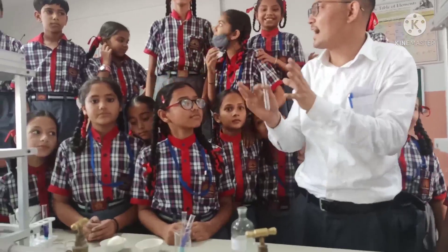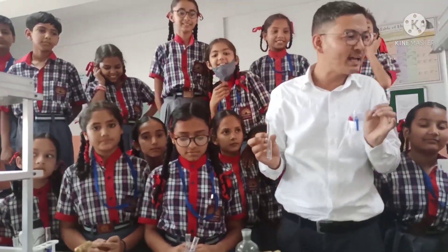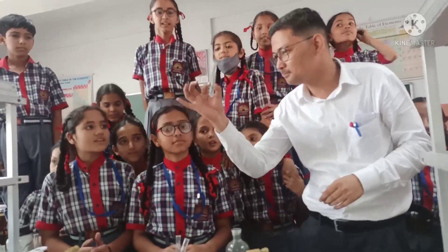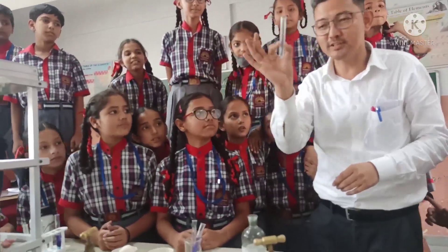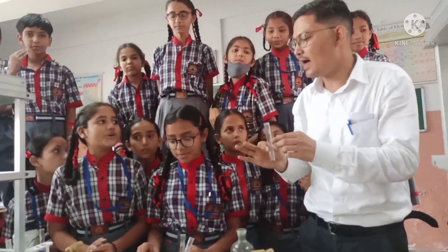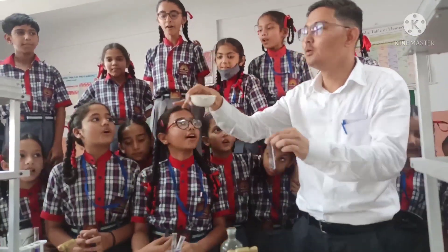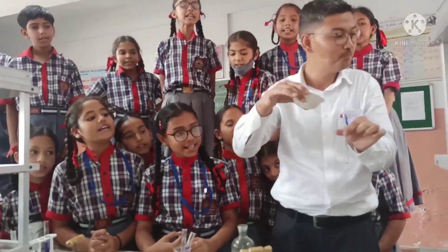So dear students, let's recapitulate the test for protein and let us discuss what are the steps. First of all, we take a test tube. And then we add the sample of protein.